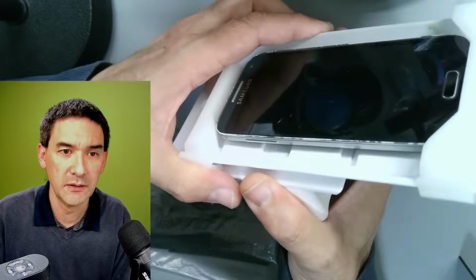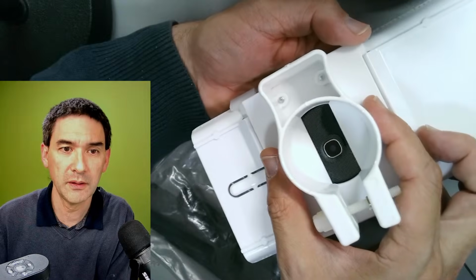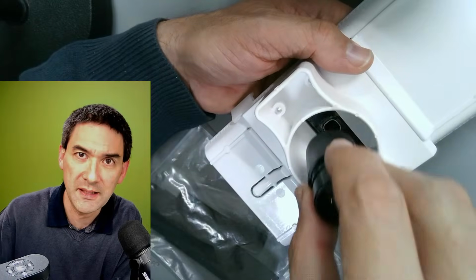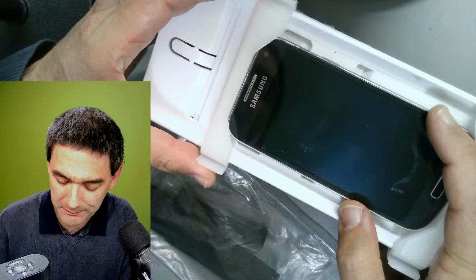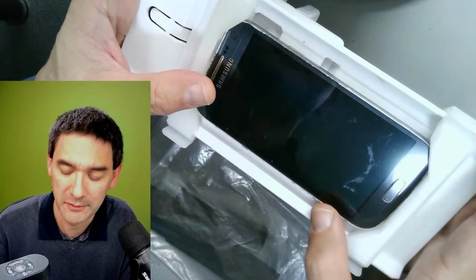Okay, until the camera is perfectly centered over the eyepiece. And the distance you have to adjust by moving the eyepiece in and out. Yeah, and this is a nice idea, but a problem: it's not stable enough.